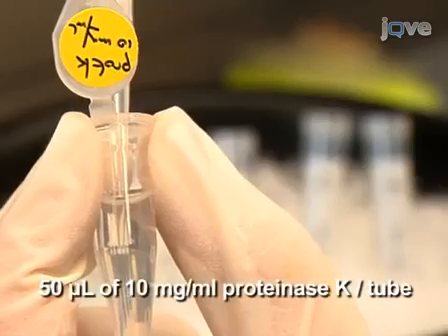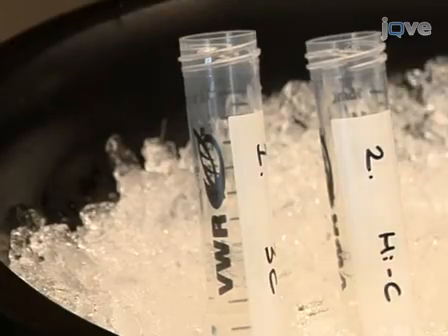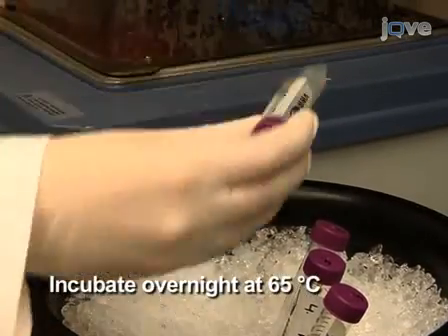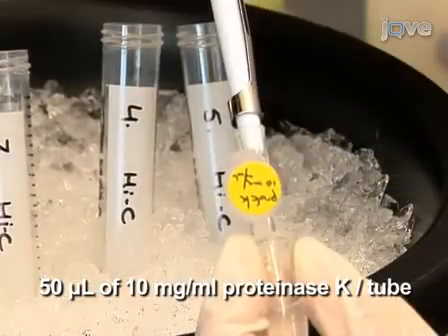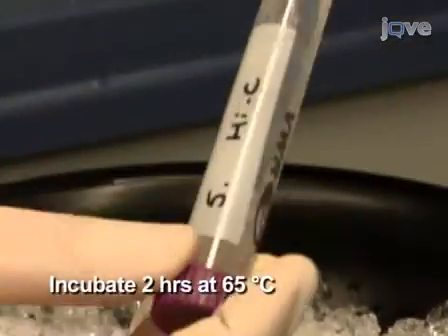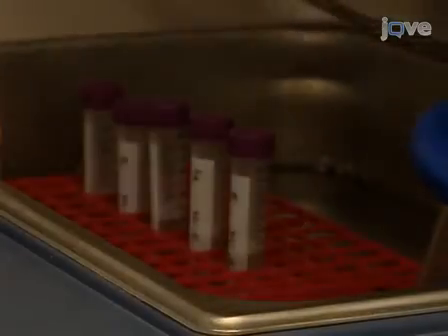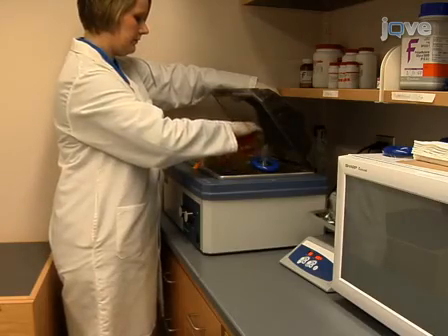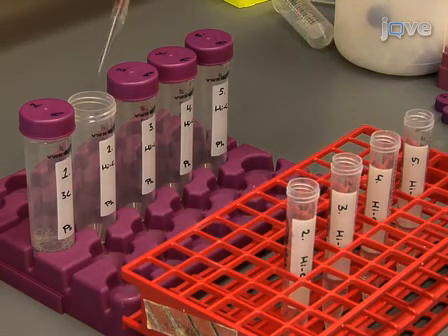Following incubation, degrade protein and reverse DNA cross-linking by adding 50 microliters of proteinase K per tube and incubating the tubes overnight at 65 degrees Celsius. Add an additional 50 microliters of proteinase K per tube the next day and continue to incubate at 65 degrees Celsius for another 2 hours. Cool the reaction mixtures and transfer them to 50 ml conical tubes.